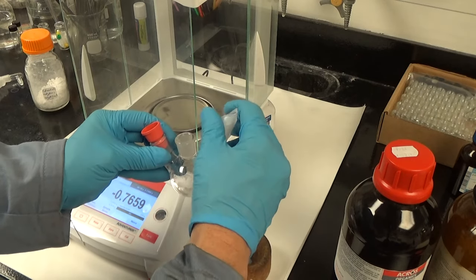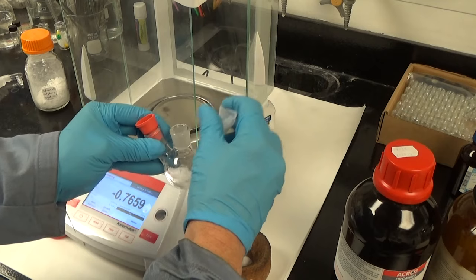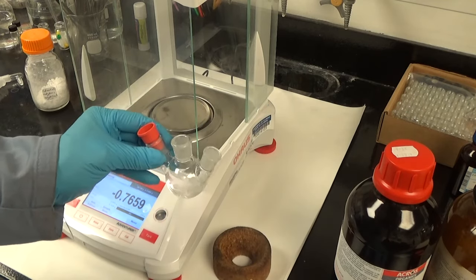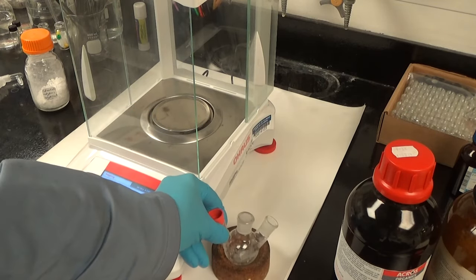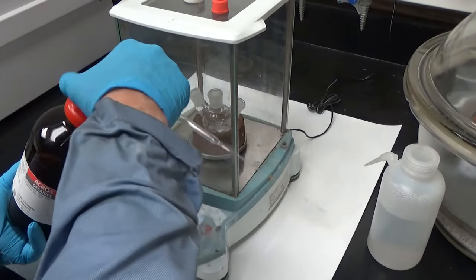And if you're like me, there's always a little bit of powder left over on the tray and I never quite know what to do about that, whether I should try to account for that by weighing out a little bit more. But I guess that's why synthetic chemists get PhDs, right?